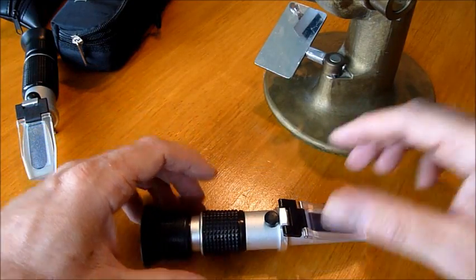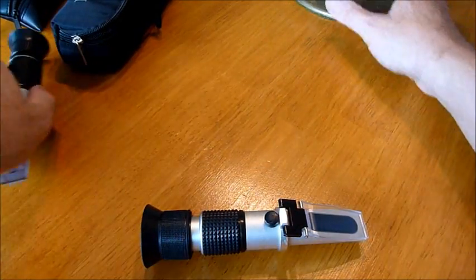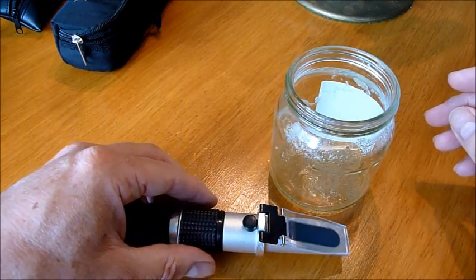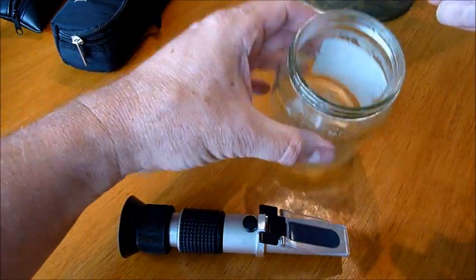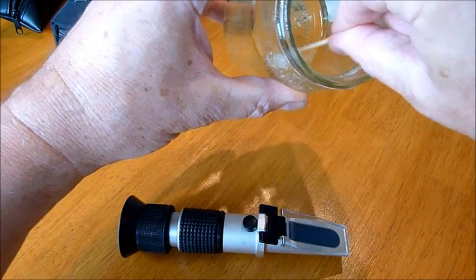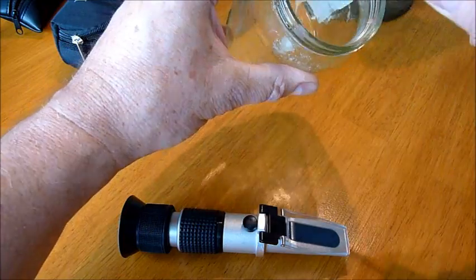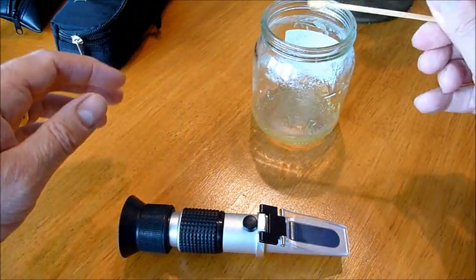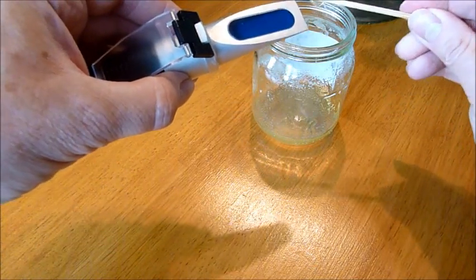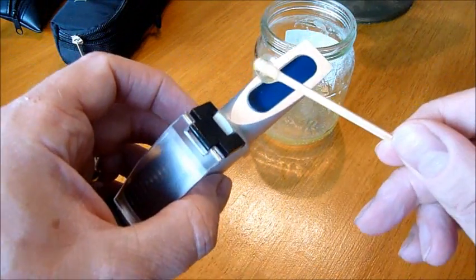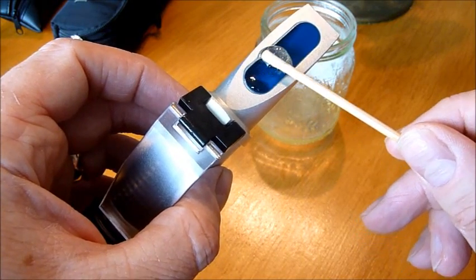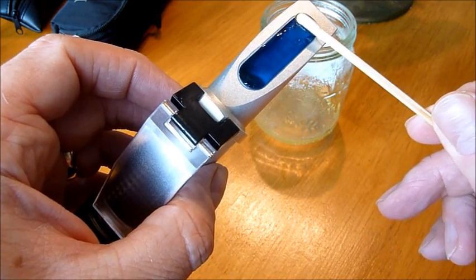Let's load it. Some of this year's crop. Last of the first pot. And the objective is to get a good sample on the prism and you want a good even coating.